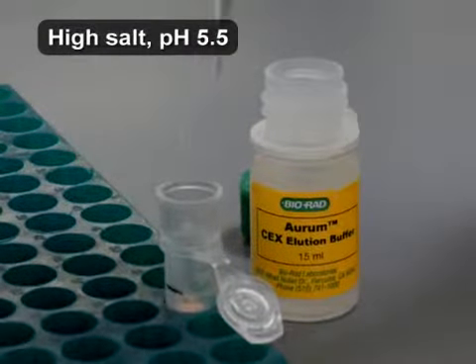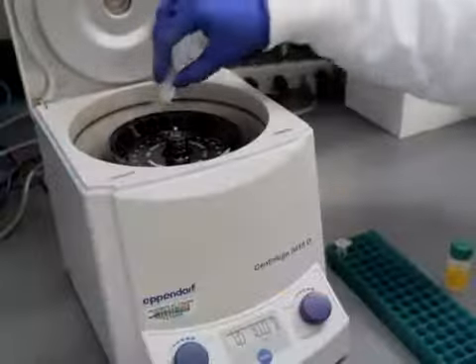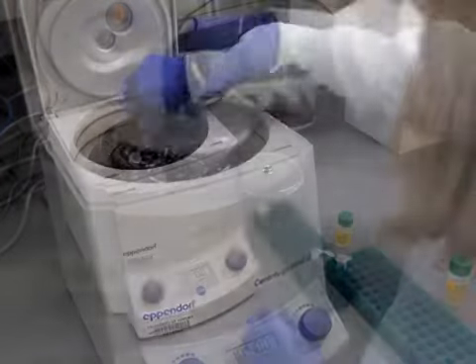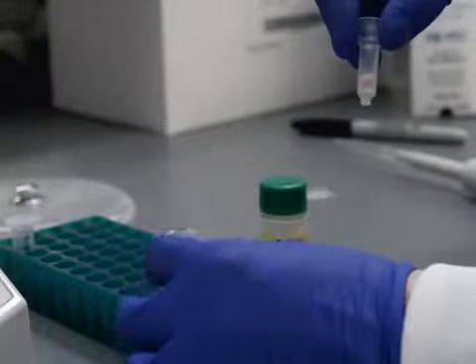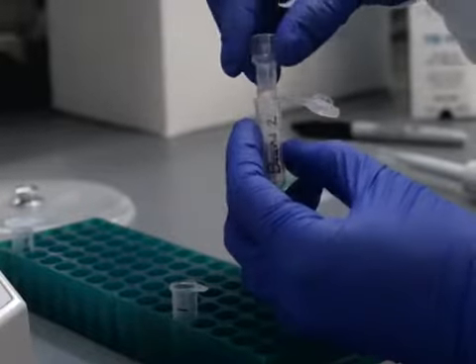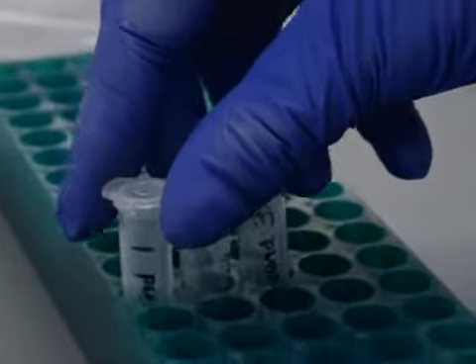Load 1 column volume of elution buffer on top of the column. Centrifuge for 10 seconds at 1000 times G. Repeat the elution step 2 more times to ensure collection of the bound analyte. Label the tubes Bound 2 and 3. Record any color changes or observations about the fractions.